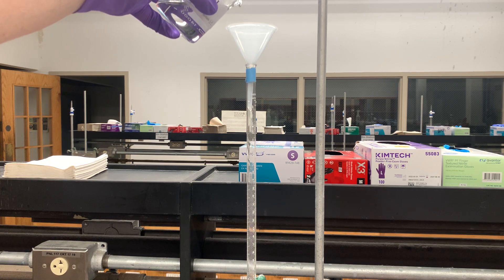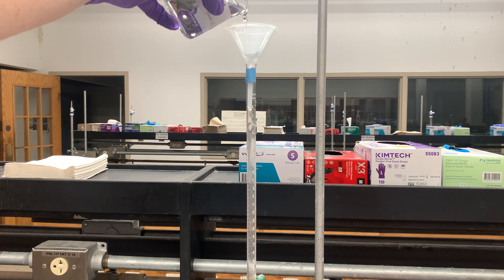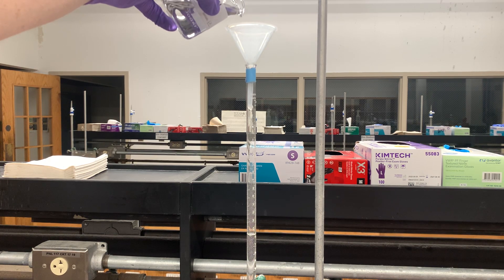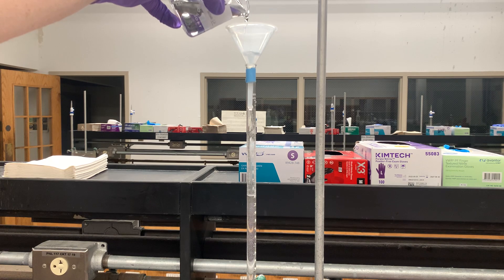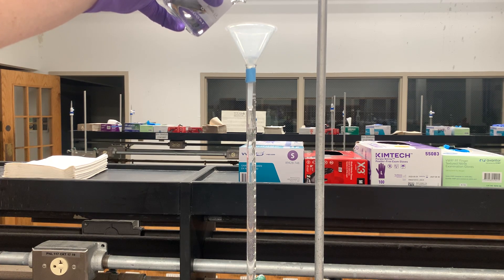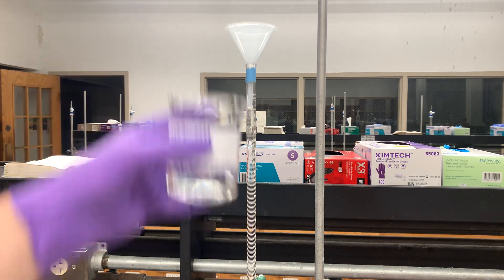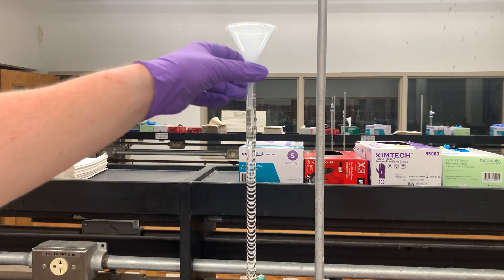Fill up a little bit more. As you can see, it's beginning to come in frame. And here we go — that's almost spot on. That's almost exactly what I want.